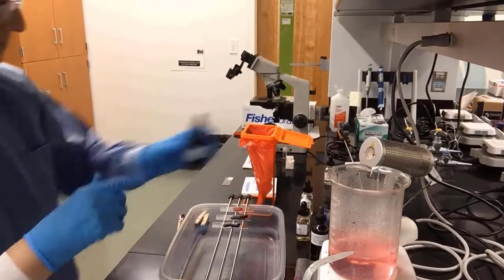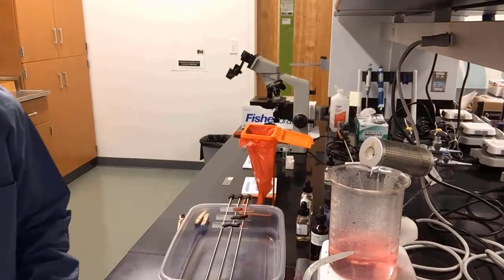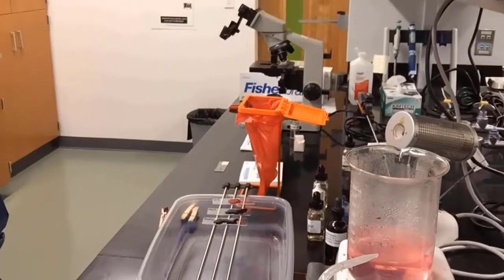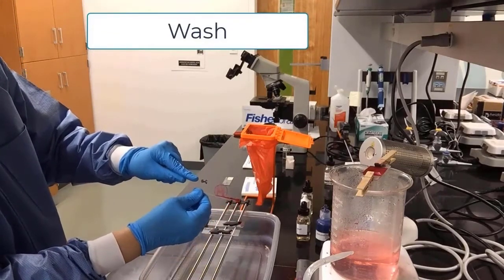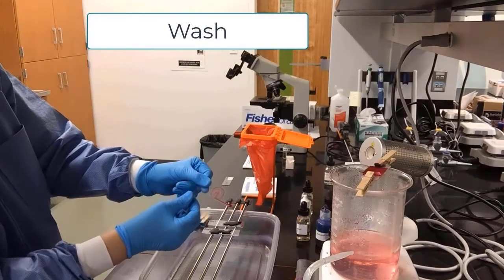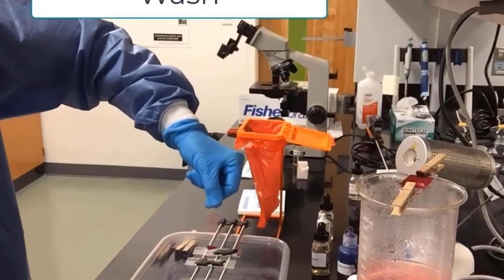We will wait 2 minutes. We'll get a close-up here. Our slides will be just sitting there for about 2 minutes. The 2 minutes are up. We make sure we cover the label with our finger so we don't wash off our labels. Then we won't know which bacterium we're looking at.